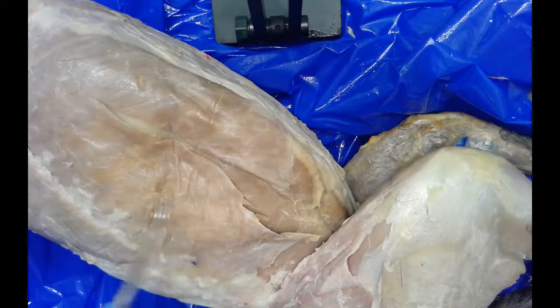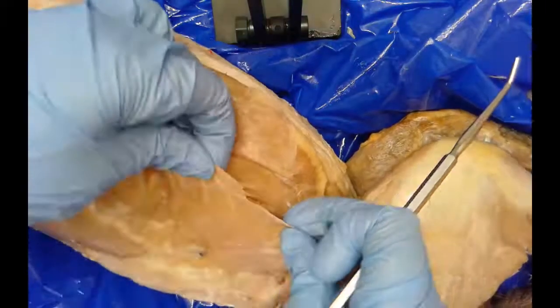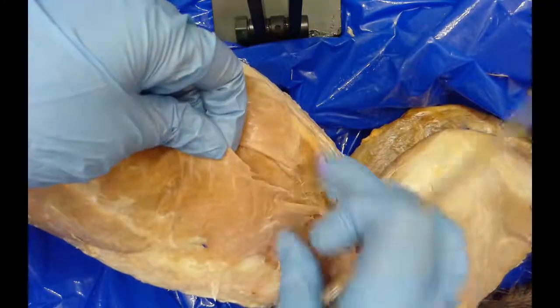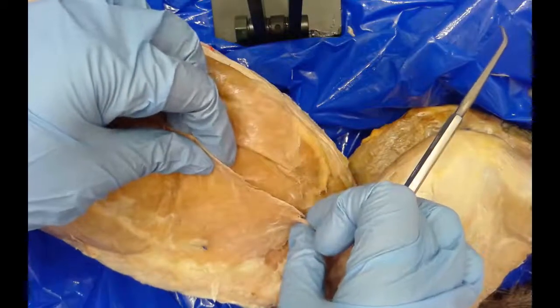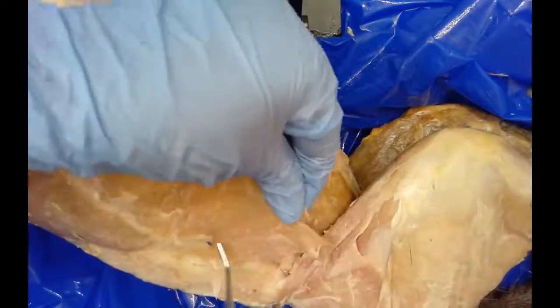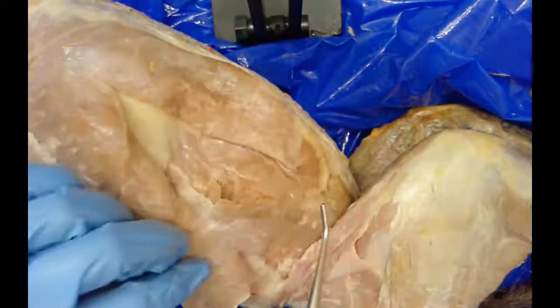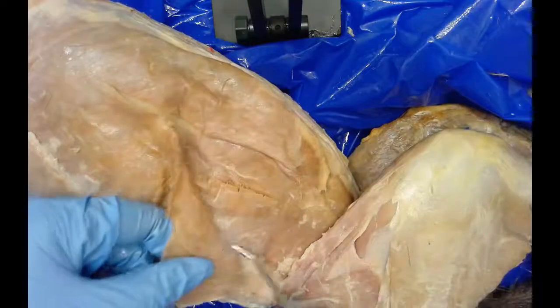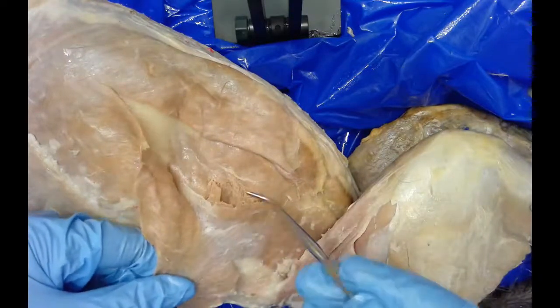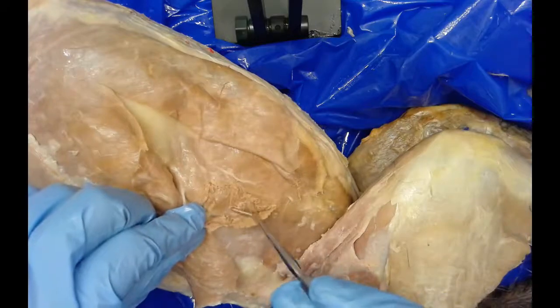This first layer we're going to look at is called the external oblique. Pay close attention to the angle that the fibers of the muscle are running — they're running in this direction here. If I lift this up and separate it, I can see the internal oblique underneath — notice these muscle fibers are running in a different direction. And if I peel even that layer back, I can see another layer called the transversus abdominis.